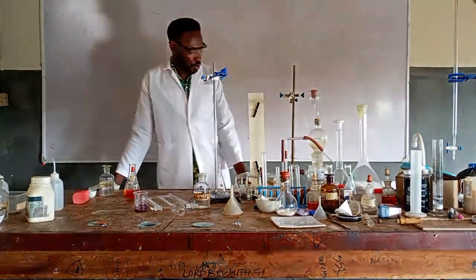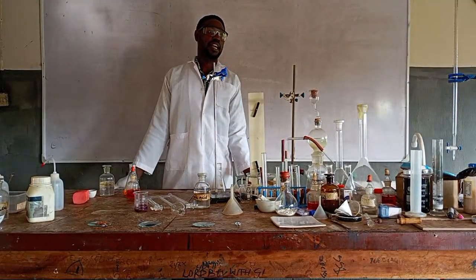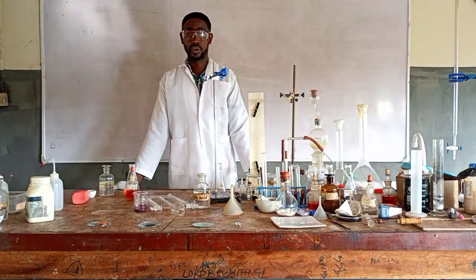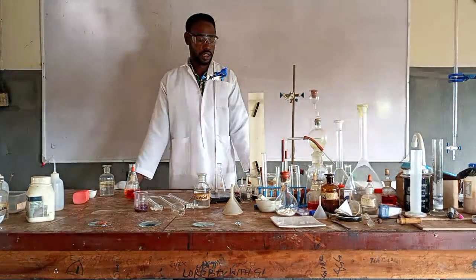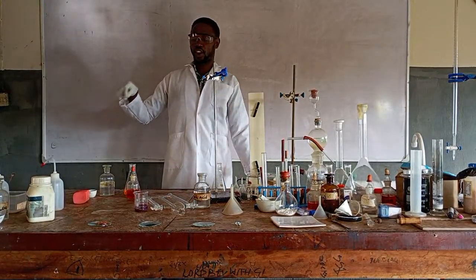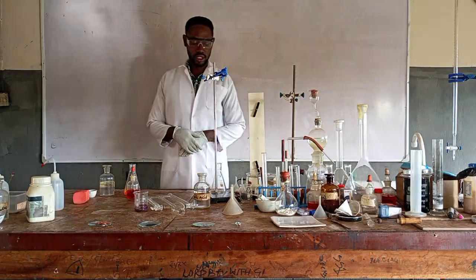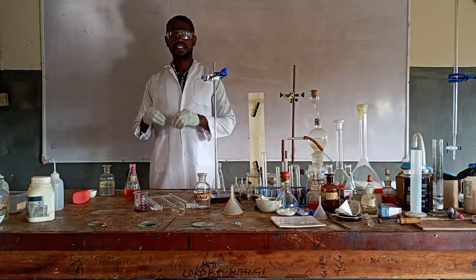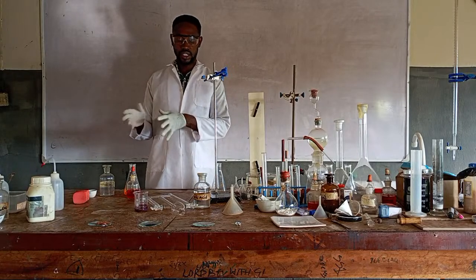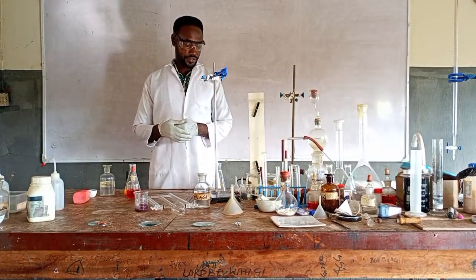Then, water is the most common thing we have, and we say that water is made up of hydrogen and oxygen by the formula H2O, right? So we want to confirm if this is true. This means the constituent of water is just hydrogen and what? Oxygen. And the only way to do that is to subject water to a chemical reaction, and it will give you oxygen and hydrogen.